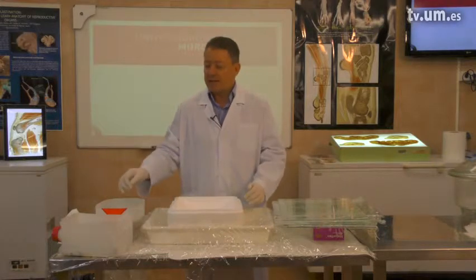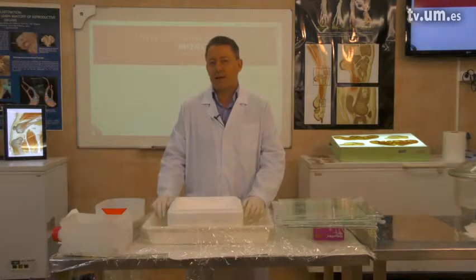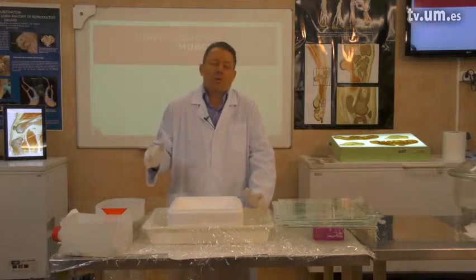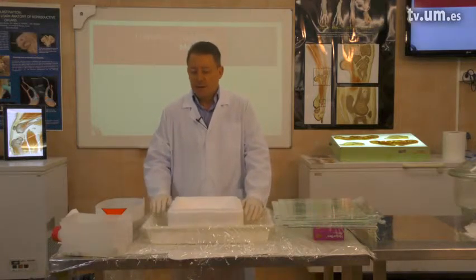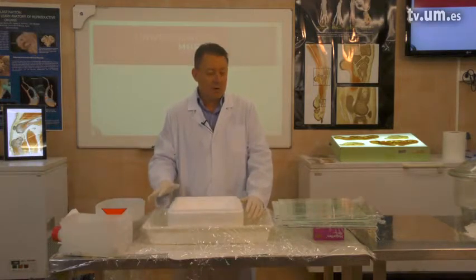So the first thing you have to do is cover everything with a foil. If excessive resin drops fall around your casting place, they shouldn't stick to your instruments, your clothes, or anything else on the table. Cover your casting table with a foil.